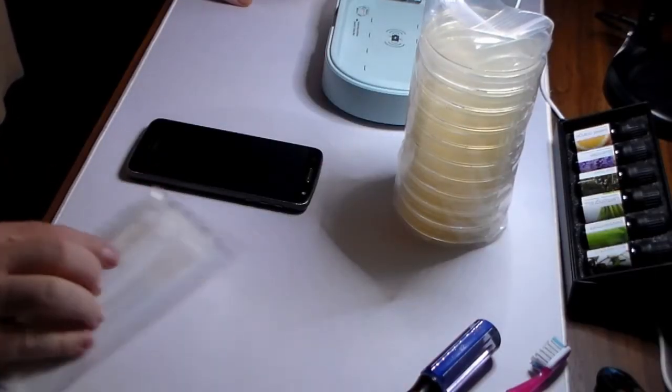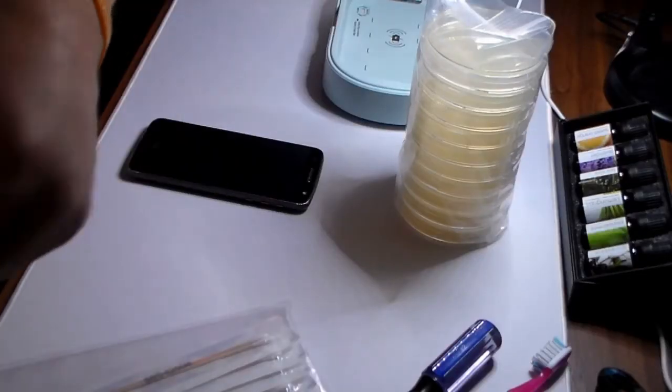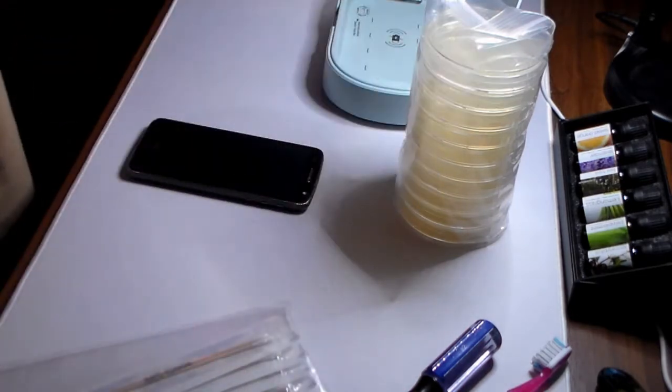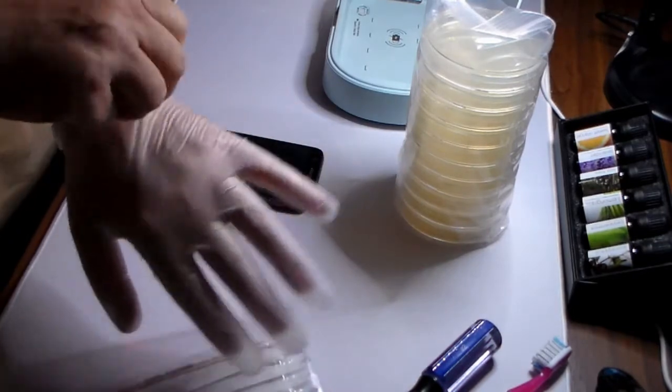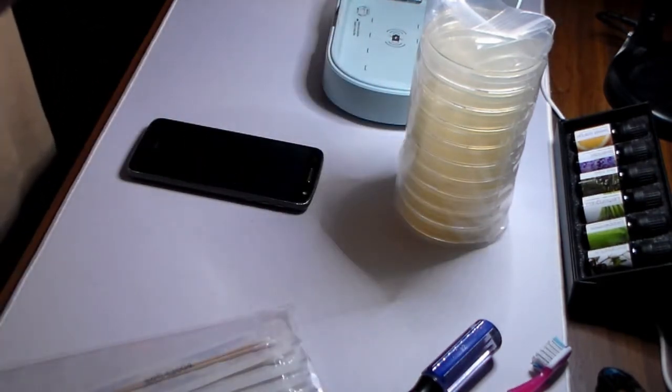This lab's Ratchet, no question about it, but we're going to try our best to follow some good practices and not contaminate the things we're trying to test here. So each one of these packets has 2 sterile swabs in it. I will have a gloved hand, and I will have a dirty hand. And the gloved hand will be clean. Okay. And I will only touch, I just touched something. So that glove's trash. Okay, I will only touch things with my gloved hand that I want to make sure I don't contaminate. Right hand is the dirty hand. Left hand is the clean hand.